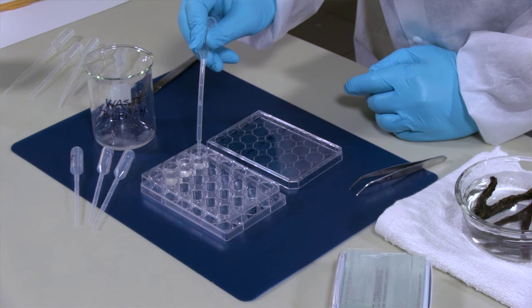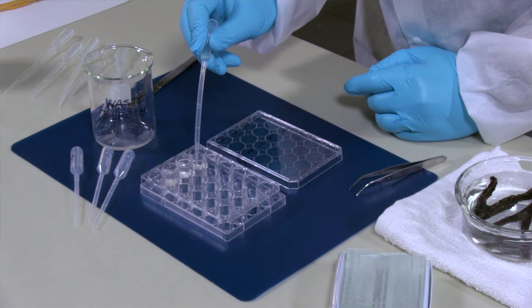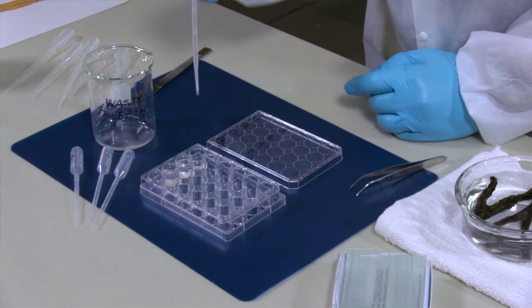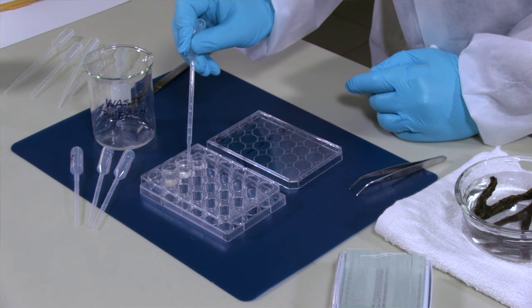Now we want to wash these again with water so we're also going to remove this water. Again be careful not to disturb the spicules and you should see a small film on the bottom of the well where the spicules are.